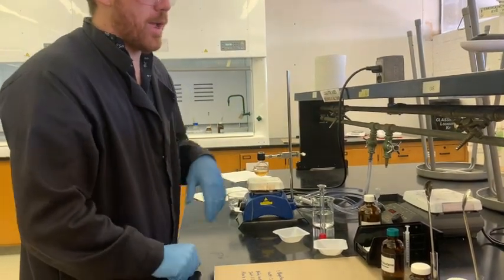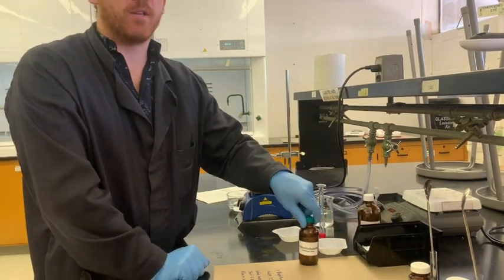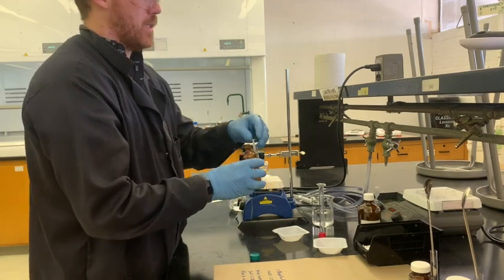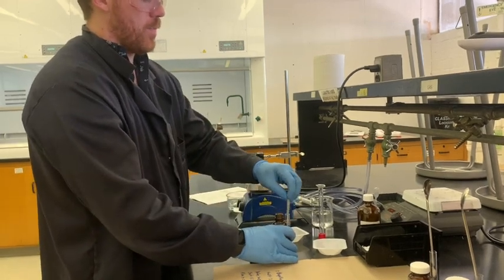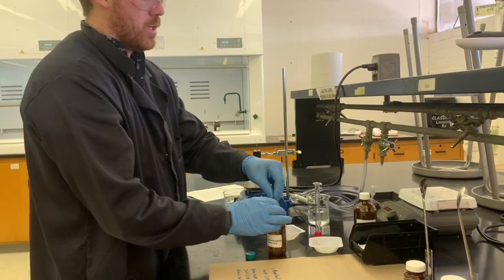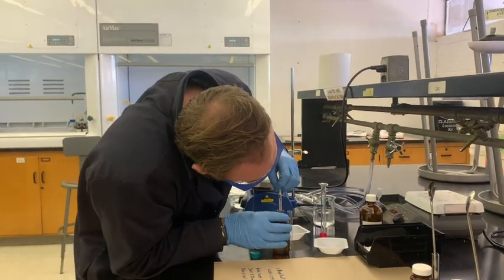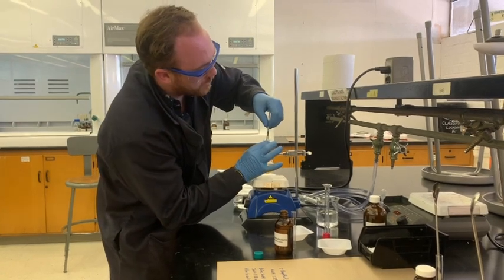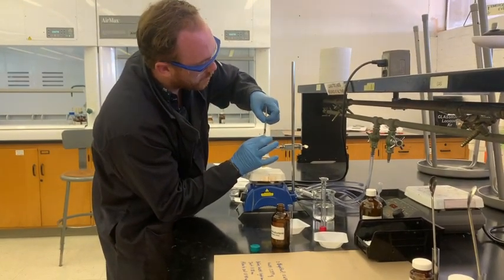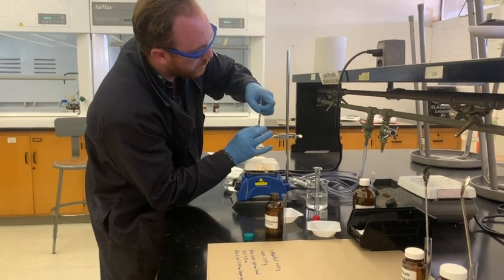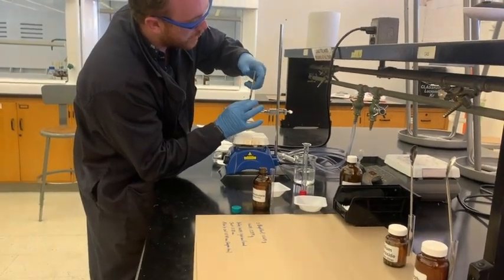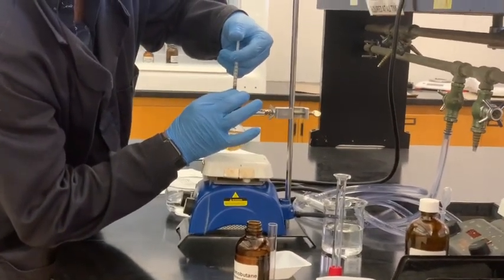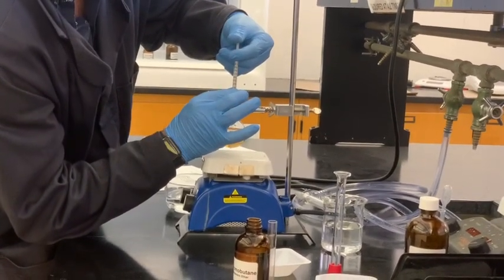And what we're going to do now is we're just going to take 0.6 milliliters of this bromobutane. The bromobutane, in this case, is just going to be added by a syringe. I'm going to take this and place as much of it directly into the pot as possible. Make sure that you note any color changes as soon as you add the solution. You might see something that happens quickly, might take a while. Always worth keeping tabs on.